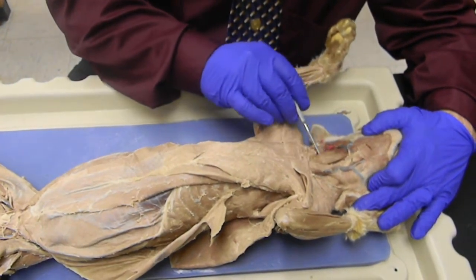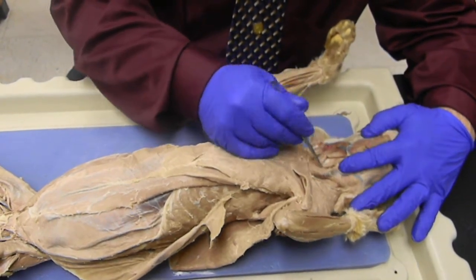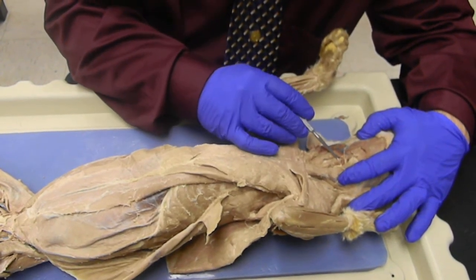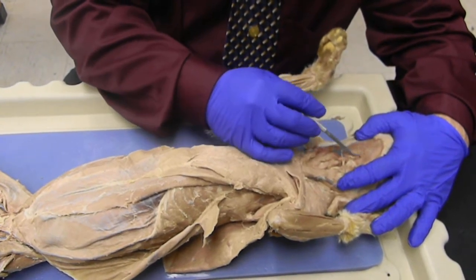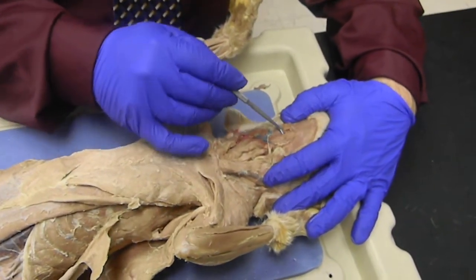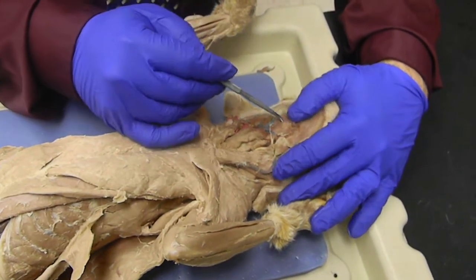We have the sternohyoid down the center, where the hyoid bone comes. On the side, we have a muscle that goes up here to the thyroid cartilage, that's the sternothyroid. The one in front of that is the thyrohyoid. One that comes across right here that's cut is the mylohyoid. The ones alongside the jaw are the digastric. Fold that up, this muscle that's paired going straight up and down is the geniohyoid.